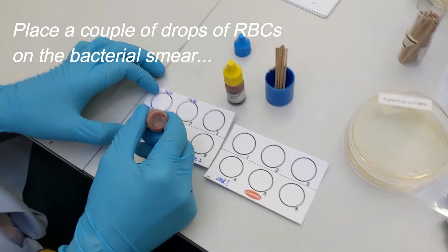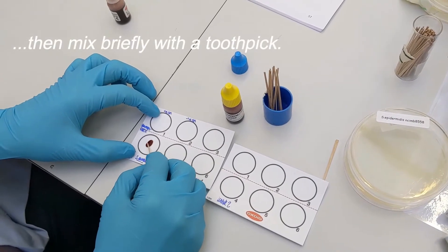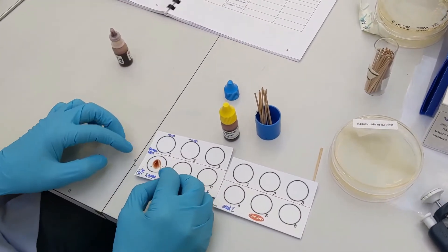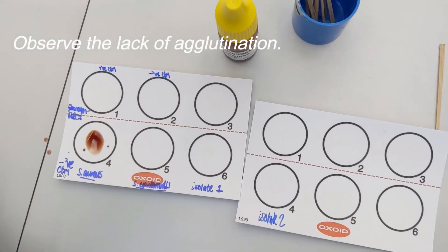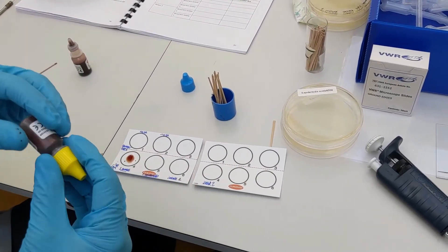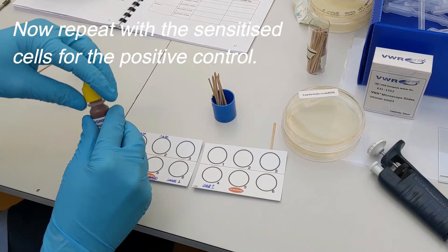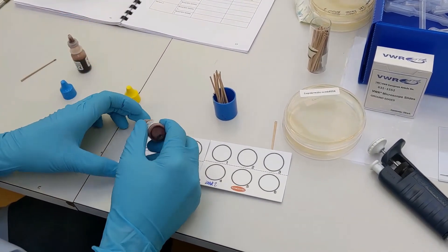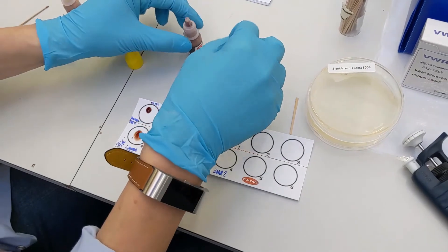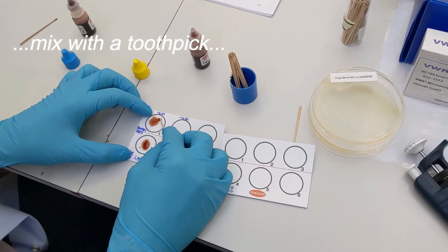Apply a few drops of the blood onto the smear, then mix with a sterile toothpick. Observe the lack of agglutination with the control reagent. Now repeat using the fibrinogen-sensitised red blood cells, mix with a fresh sterile toothpick, and observe the agglutination.